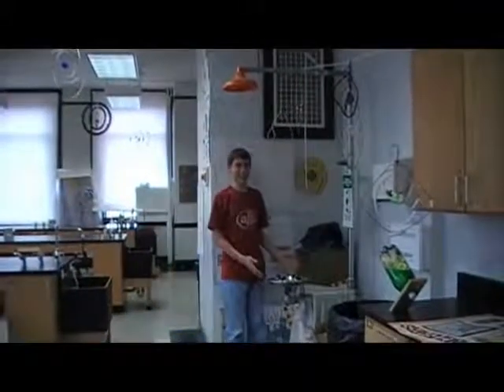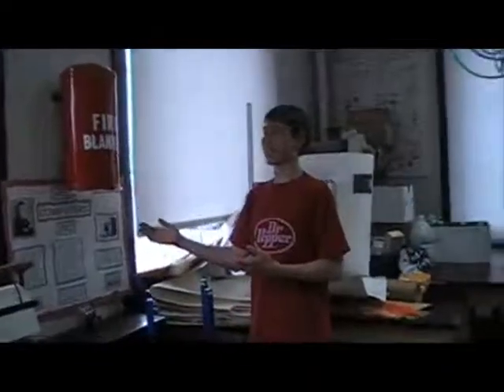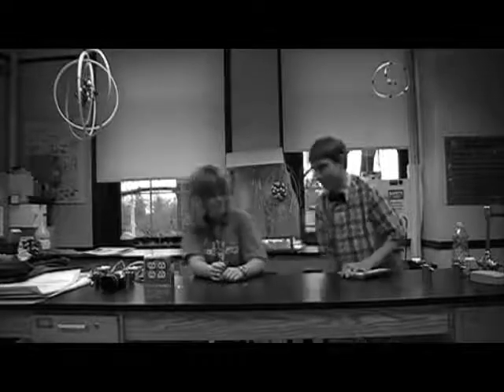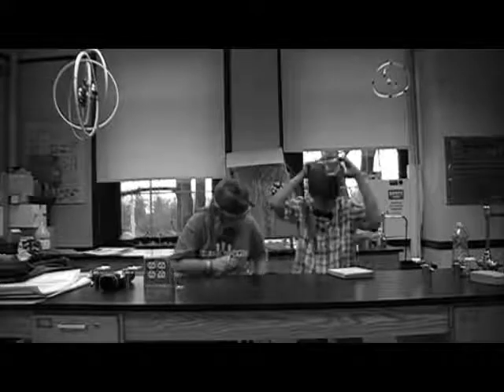Well, we should always know where your safety equipment is. Like the eyewash station. And the shower. The fire blanket. And the fire extinguisher. And your instructor! Always make sure you are working in a proper lab facility. And you can't forget about those goggles. Make sure they're adjusted properly. Very good.